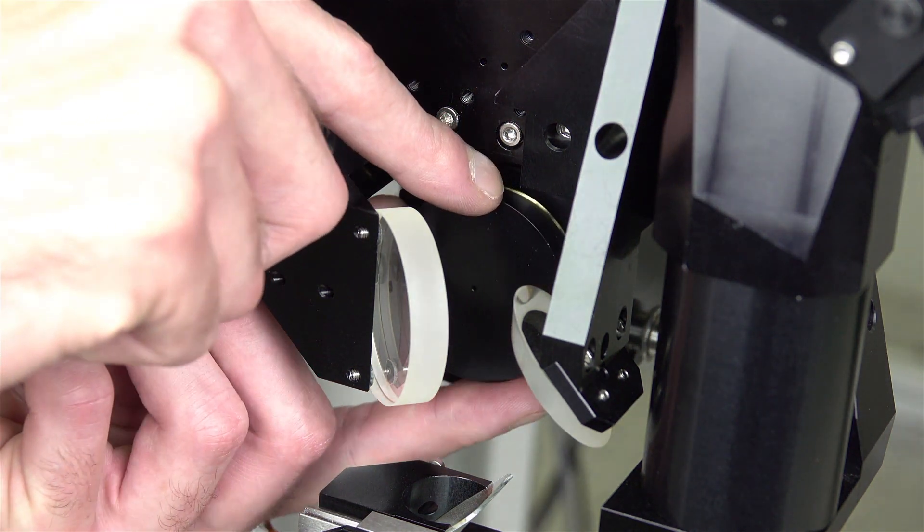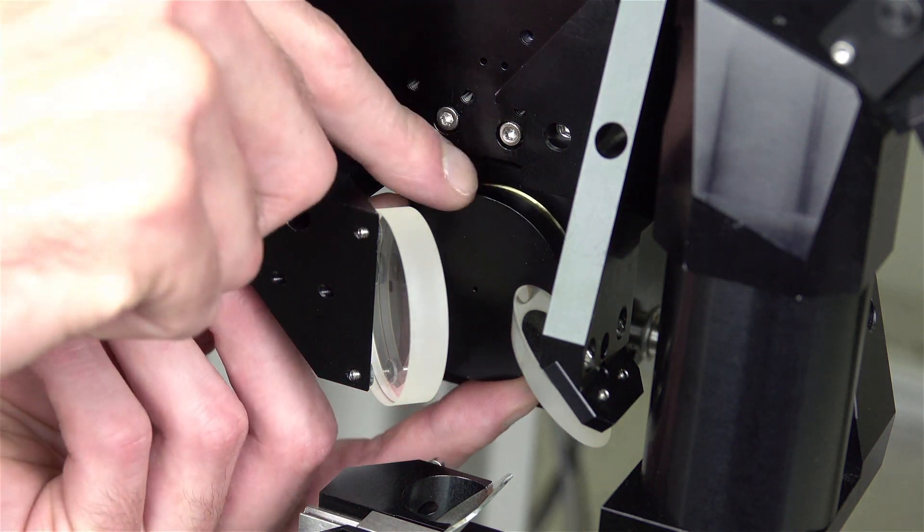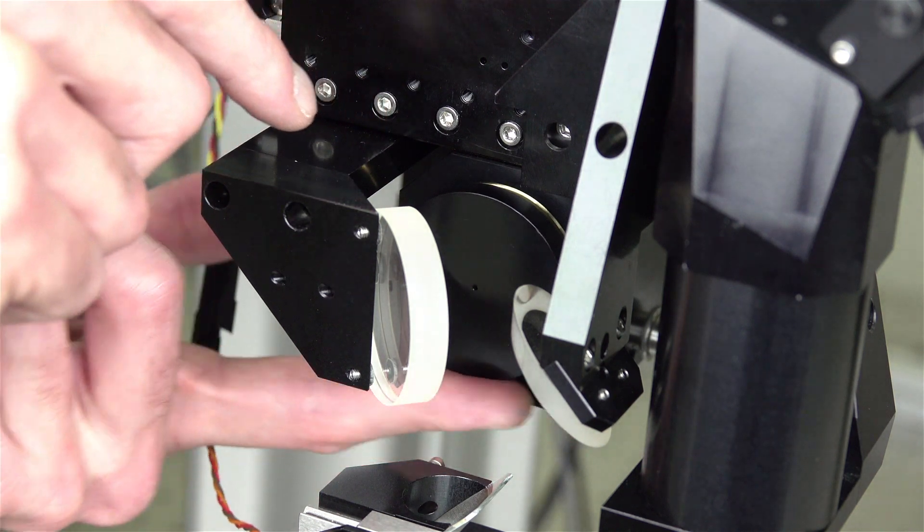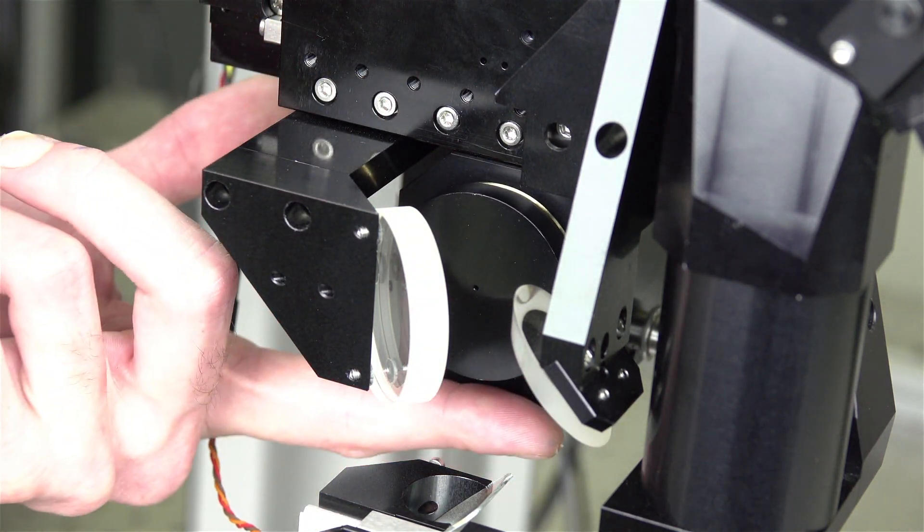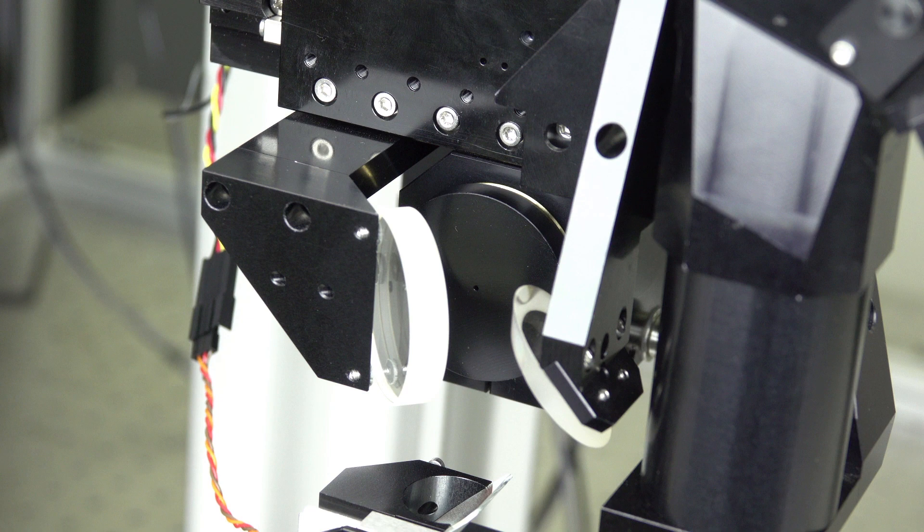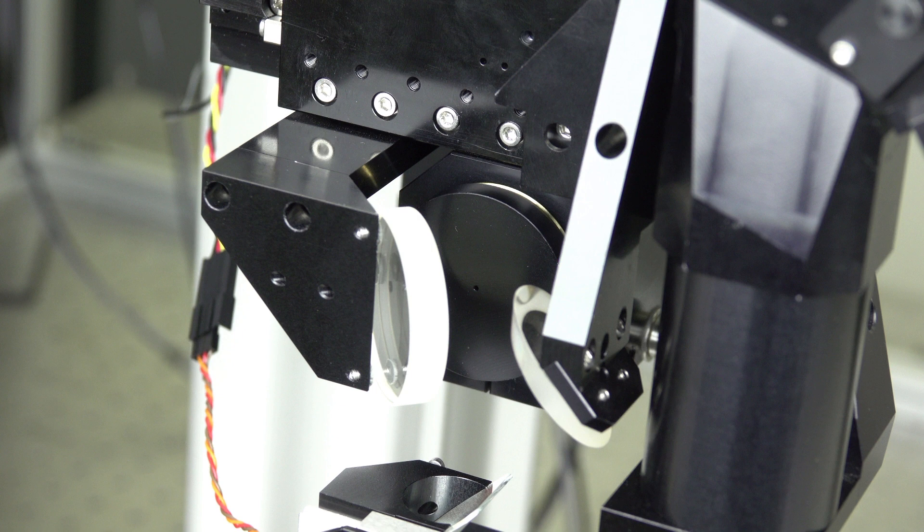and very carefully thread on the pinhole for the tube lens. You'll notice the mirrors on the head of the microscope are very close to where you are working. Please be extremely careful not to touch, bump, scratch, or even look at them too closely. They are very delicately mounted on their brackets in order to reduce stress on the optical elements, so they are quite easy to break off.